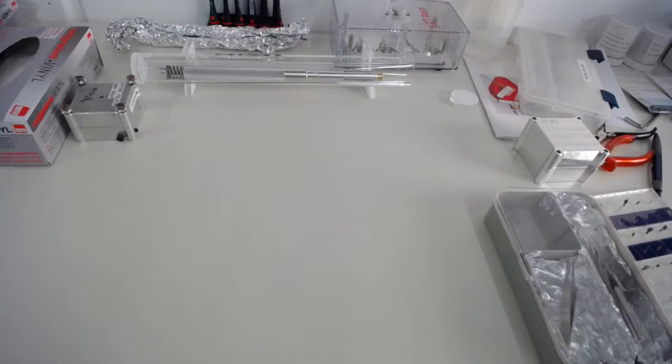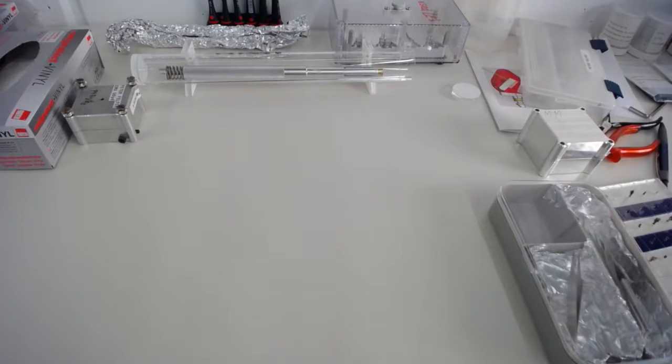Hello everyone and welcome back to the second part of the tutorials on how to operate the local electrode atom probe. The second part now is on how to insert your samples, generally what do samples look like, what do the sample holders, which are called pucks, look like, and so on and so forth.